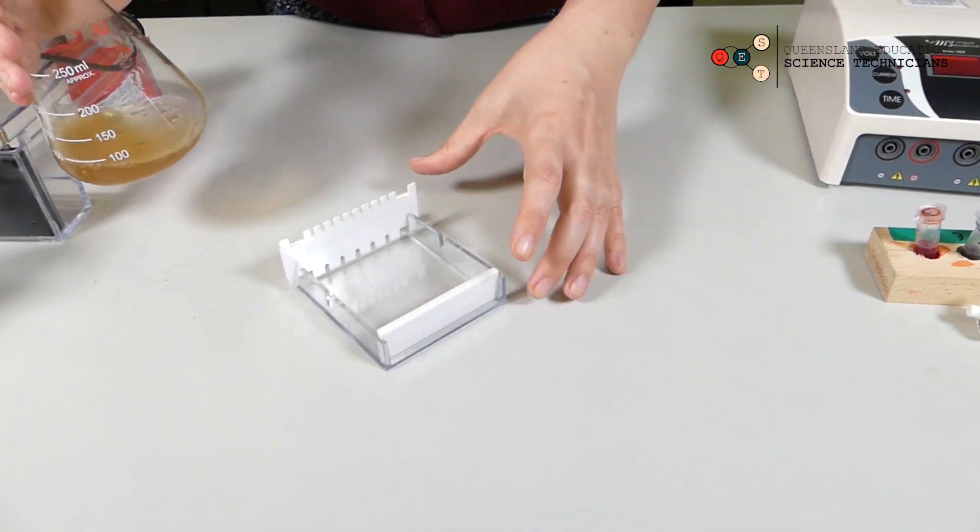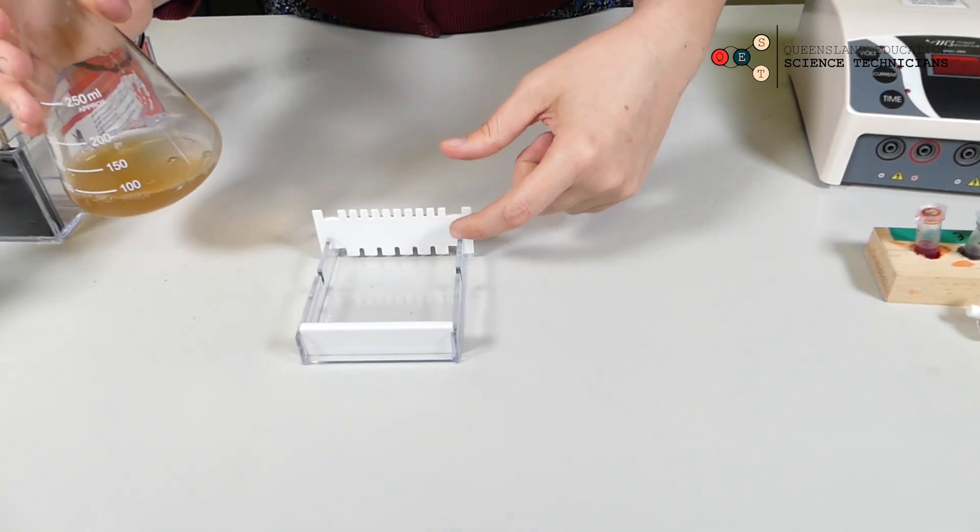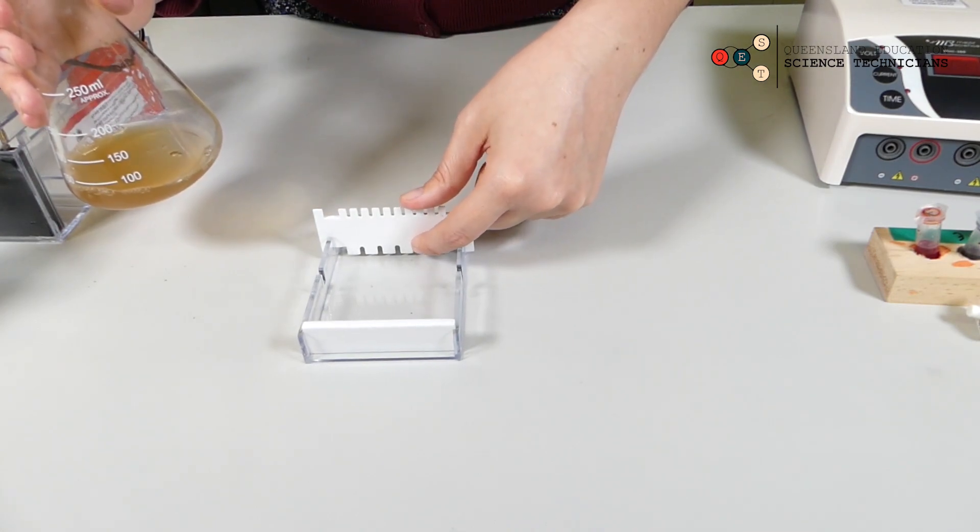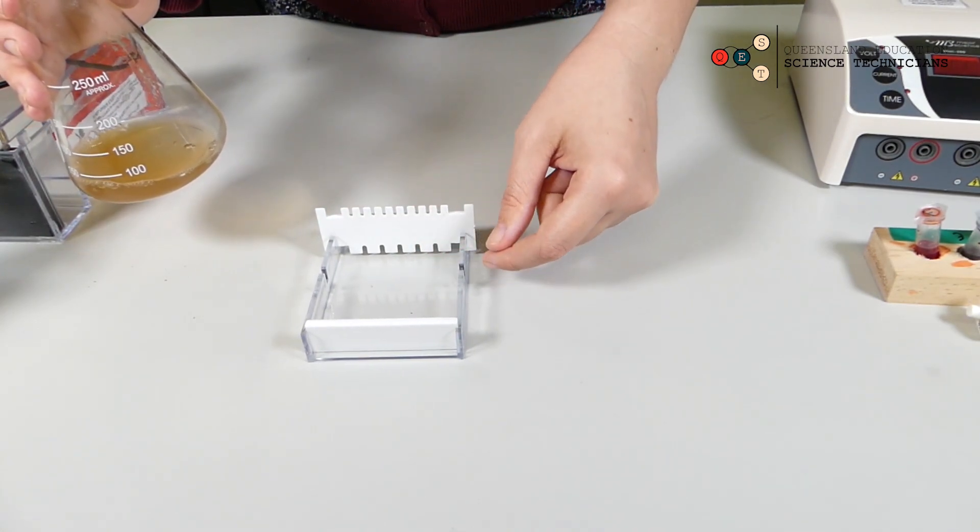I'm just going to pour it into my gel mold so that the teeth are in it but only just. You don't want to overfill it.